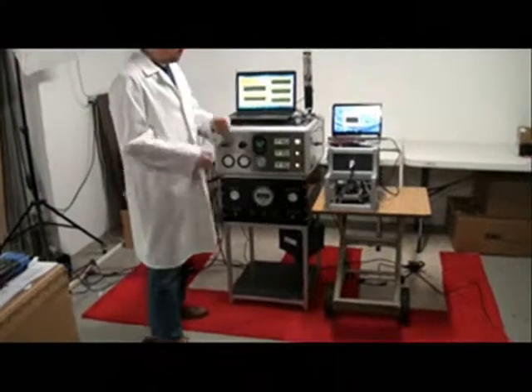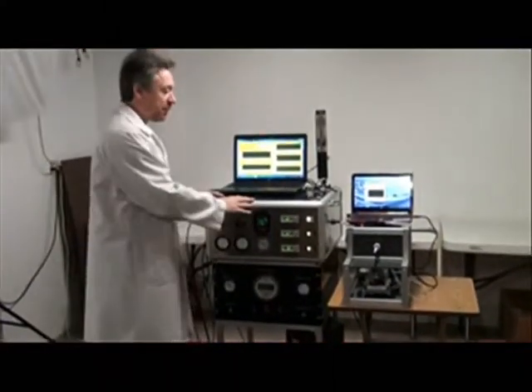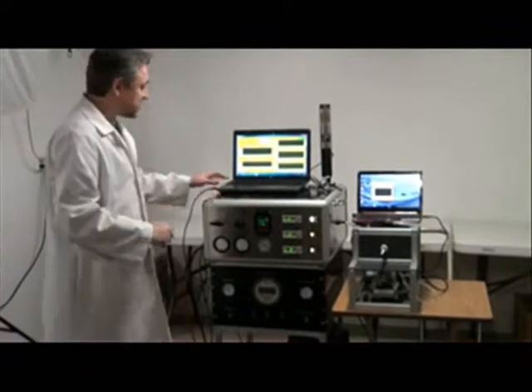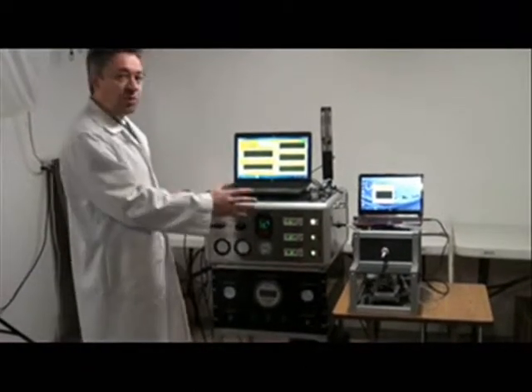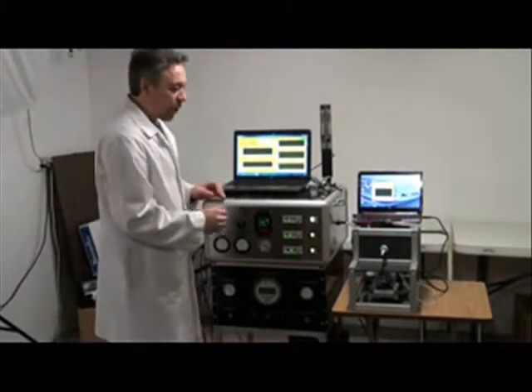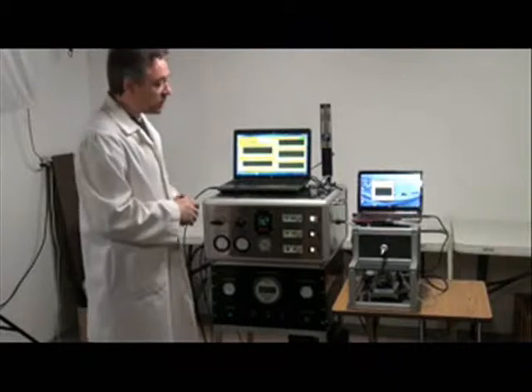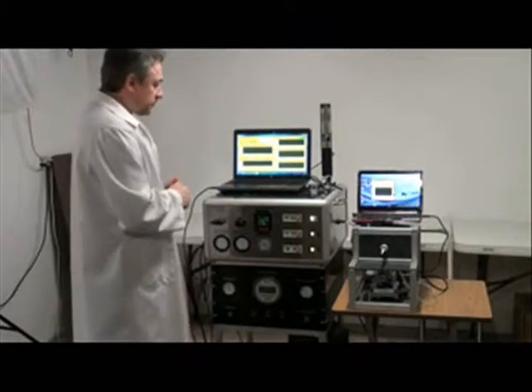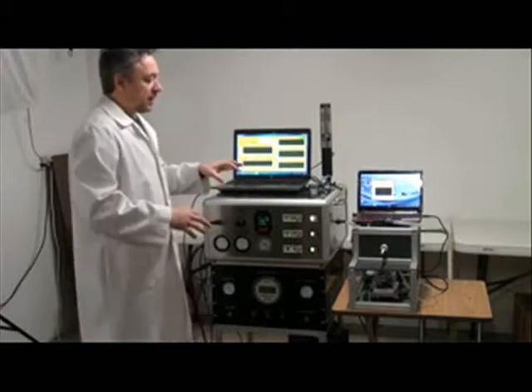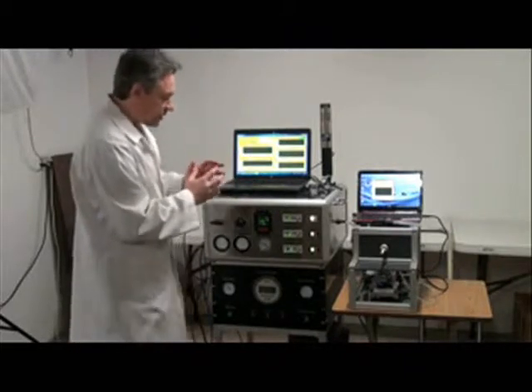We have here a cigarette smoke generation system coupled with a concentration control siphon. It can be used for either cigarette products or e-cigarettes. The siphon basically works this way.